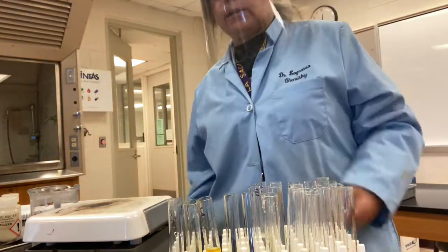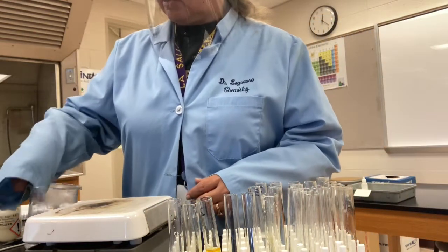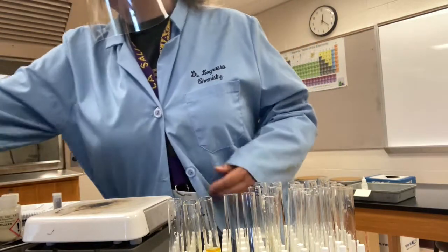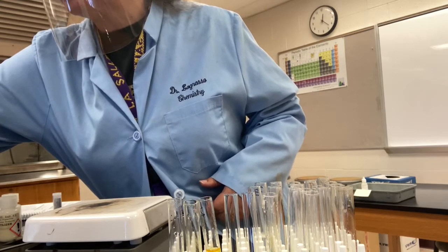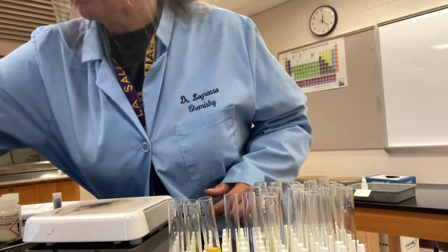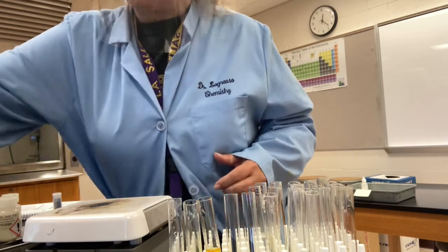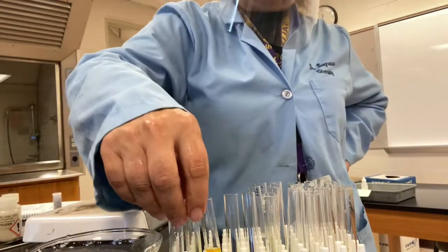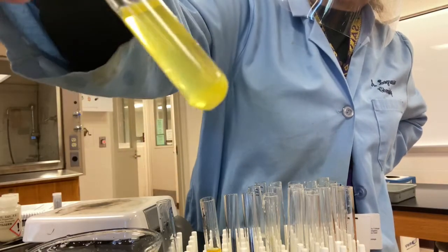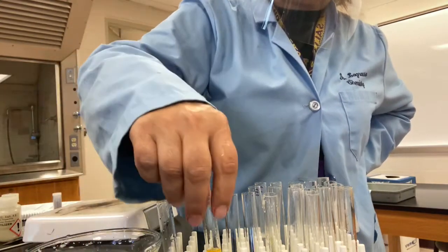Okay, I'm going to cool that down and see if that'll encourage our precipitates to form. So I'm going to put a little cold water into our beaker. Let's see, now, ooh, okay, so now number one, like I said, for sure has precipitate in it. You can see that it's cloudy. I'm going to put it in there and see if that encourages more precipitate.